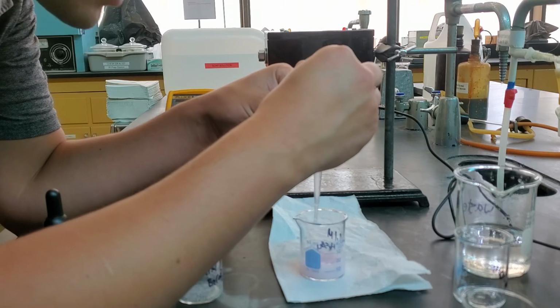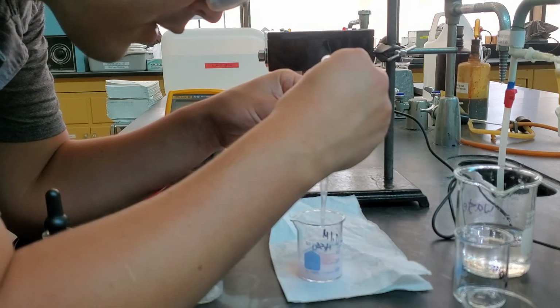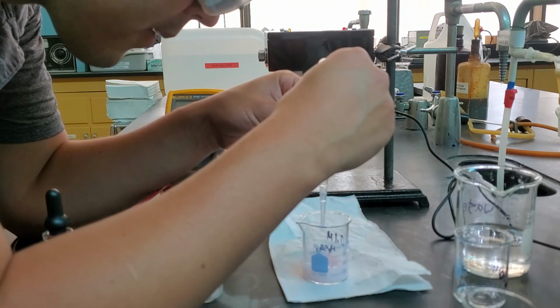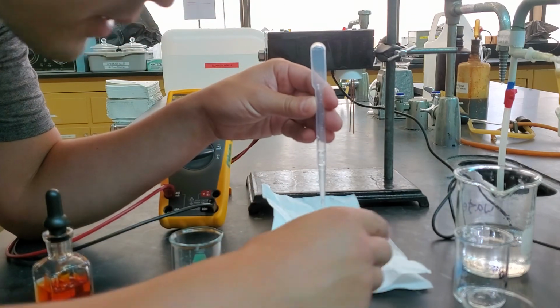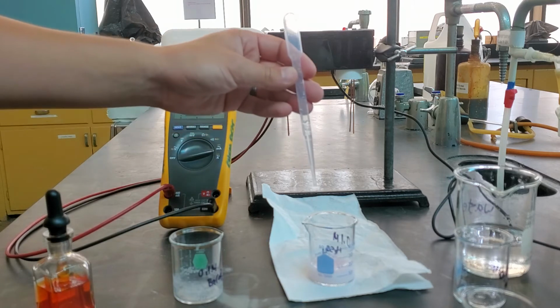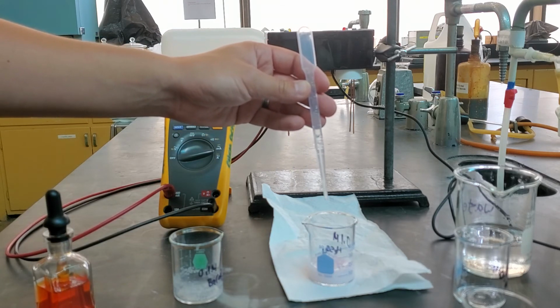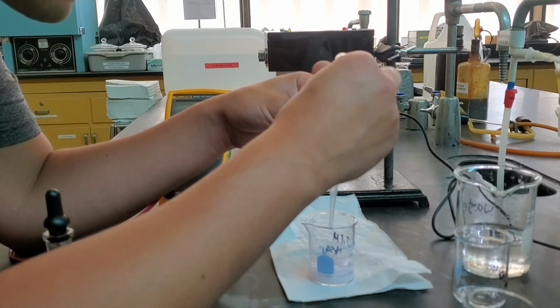Now when I'm dropping this in, I can tell I'm getting closer because when the drops go in, I can see a very faint blue for a second there. If you look at our color, we're no longer in that pink phase. And so we're trying to move on past that to that blue. We're kind of in that yellow phase right now.